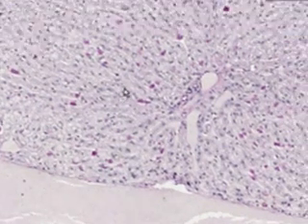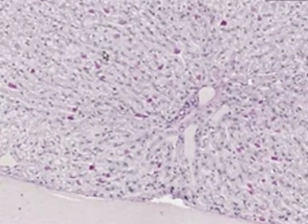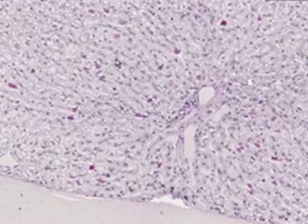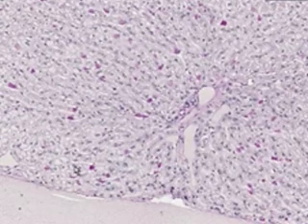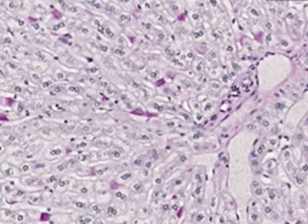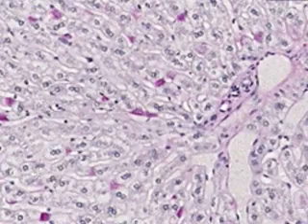But I'm also going to show you next a slide in which differentiates Kupffer cells from hepatocytes very well, because it's going to be a slide in which carbon particles were injected, and the gobbling up Kupffer cells are going to stand out like a sore thumb. Otherwise, when you look at this, sometimes it's hard to differentiate Kupffer cells from hepatocytes, other than the fact that you know that hepatocytes have to have round nuclei, and Kupffer cells like here and maybe here and maybe here are more spindly. Thank you very much.